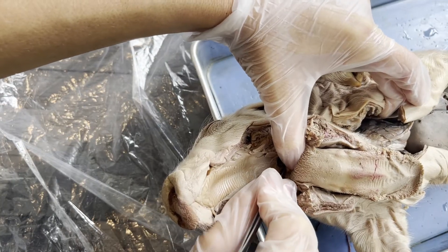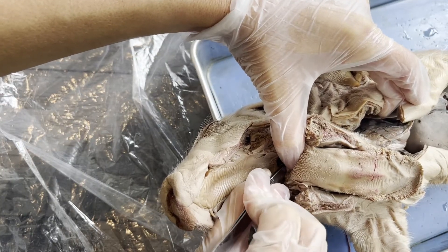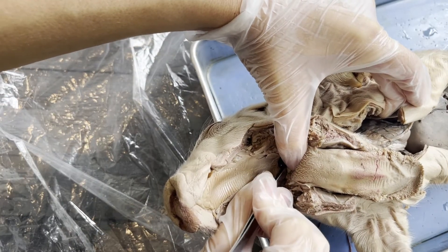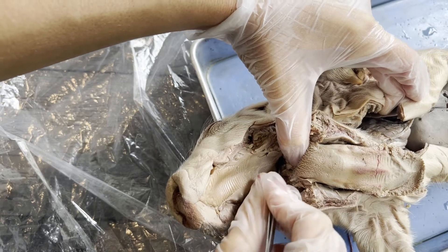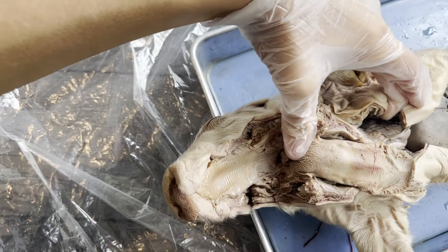I think the trachea opening is right around here — if I push there, I'd go to the lungs. And behind that, we have the esophagus.